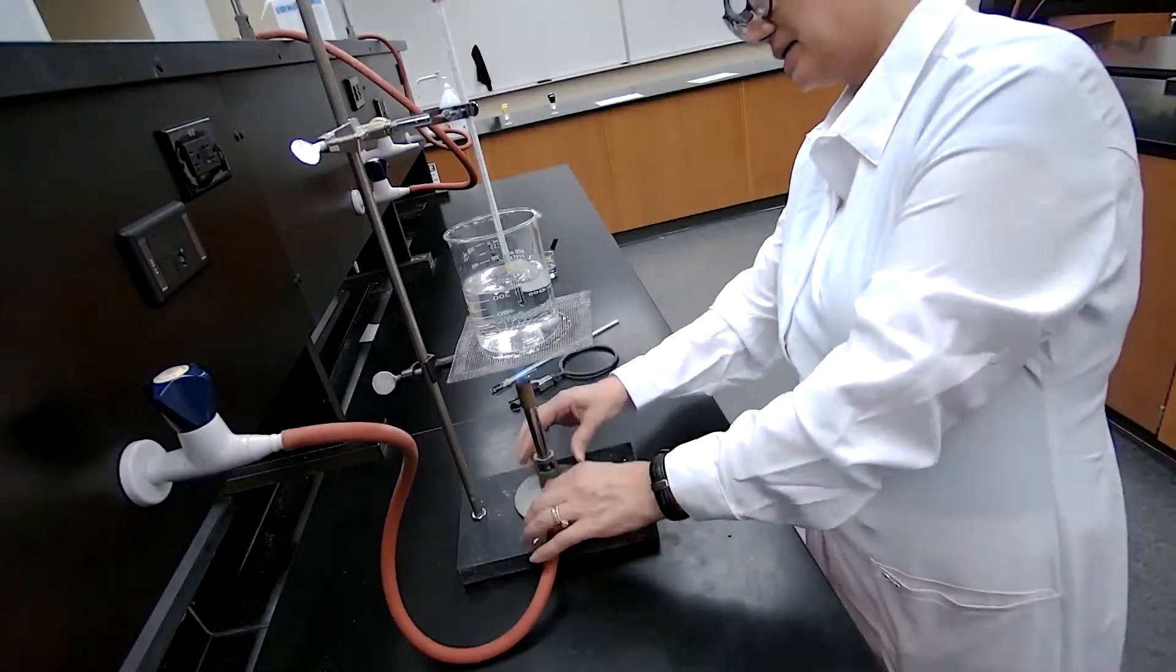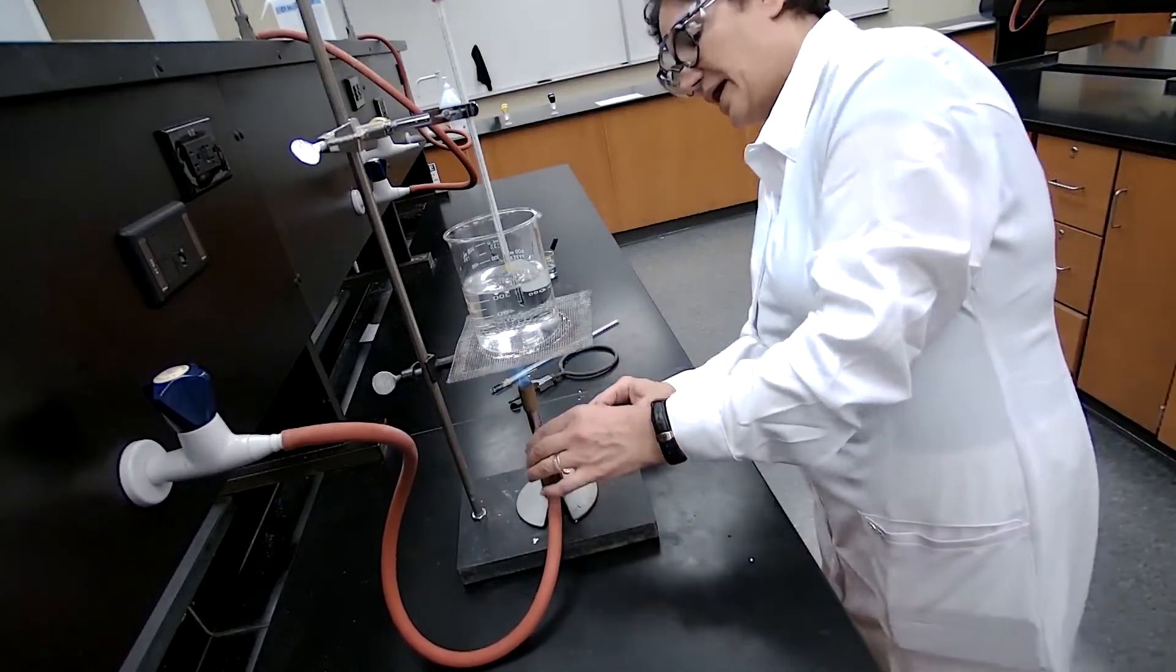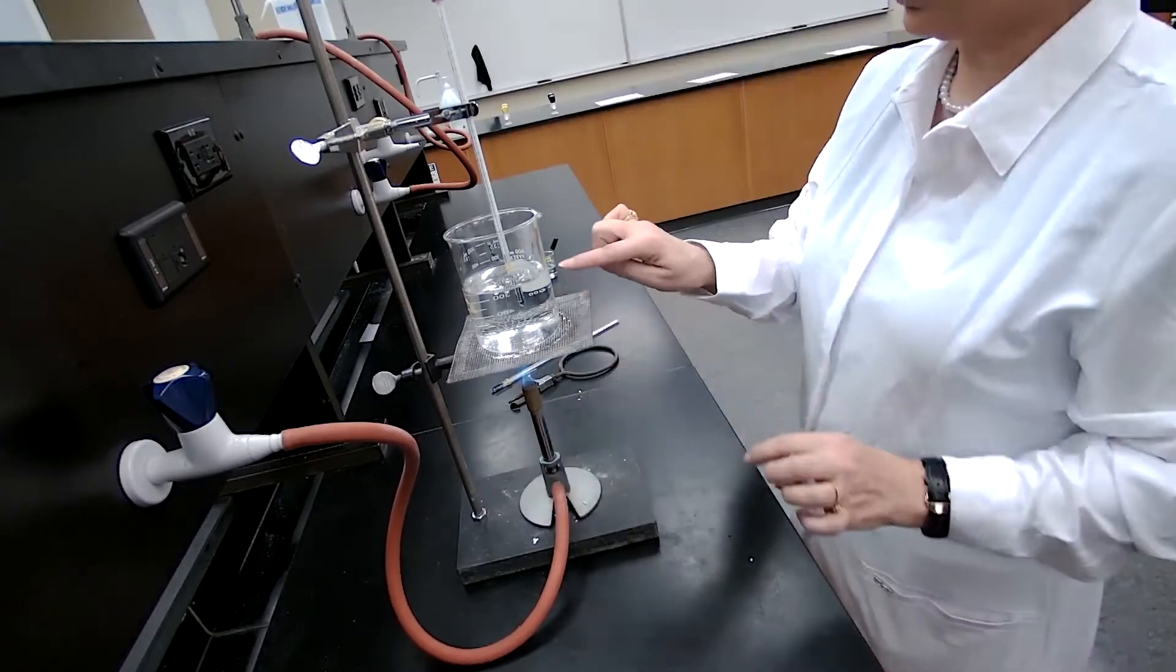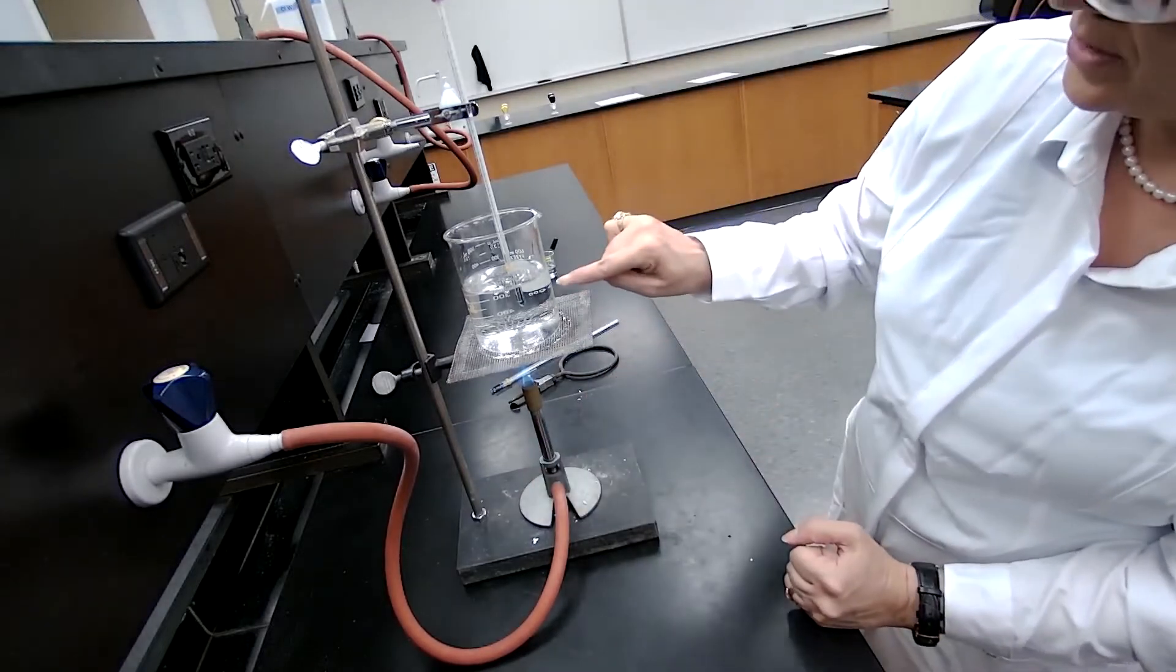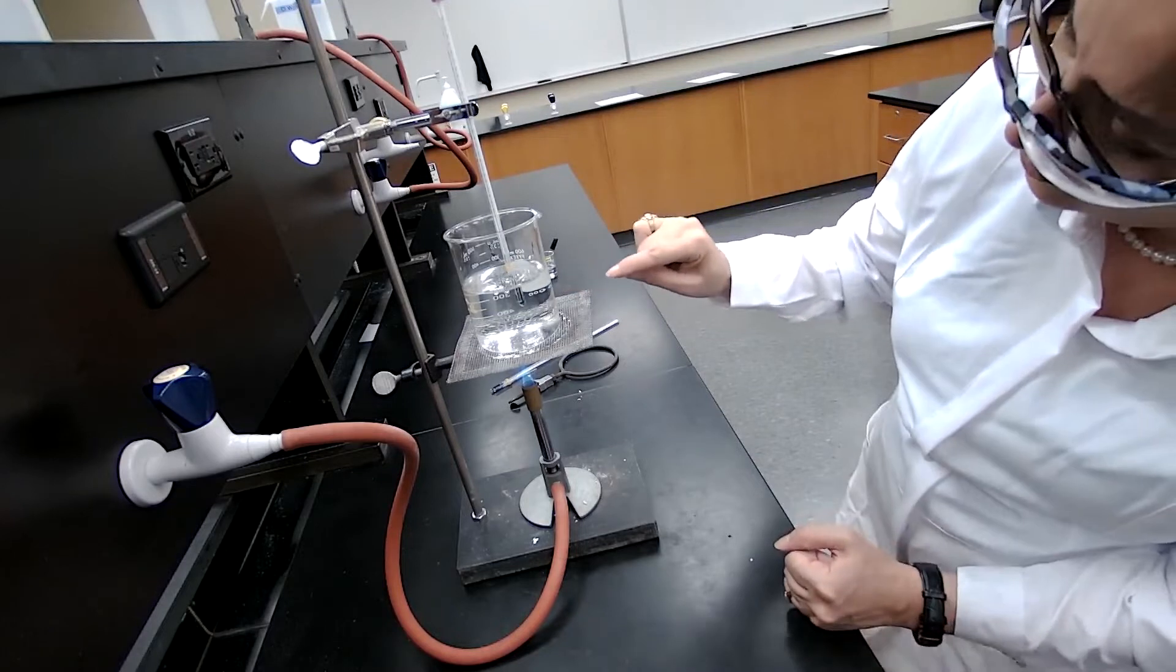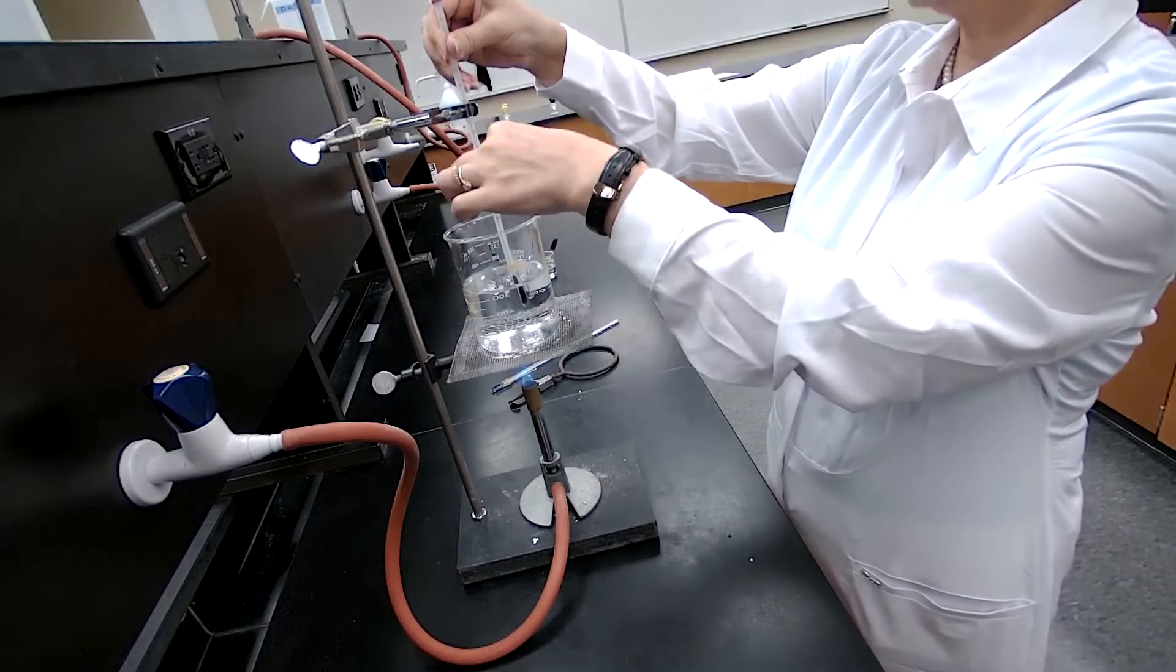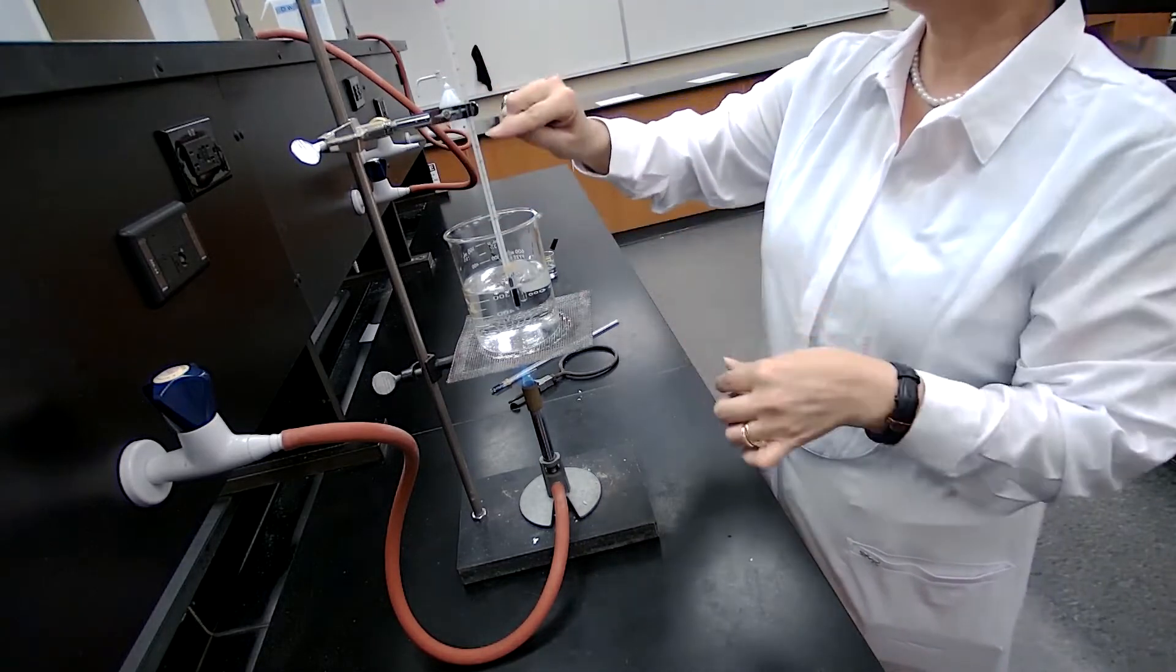I place it under the beaker. And when the temperature equals the boiling point of the solution, I will look for those bubbles. And I should be able to record the temperature.